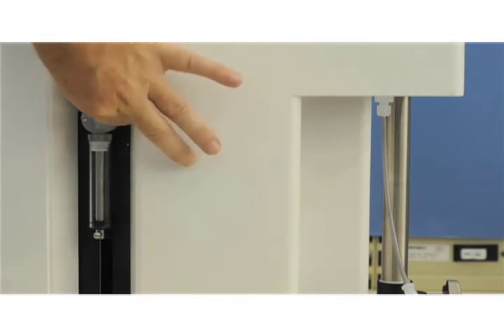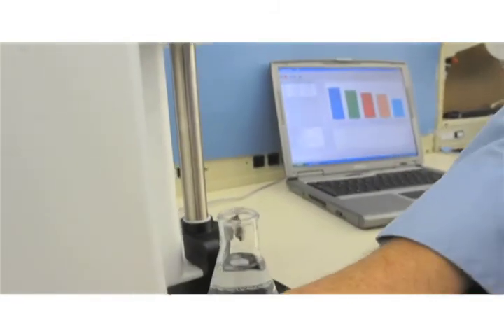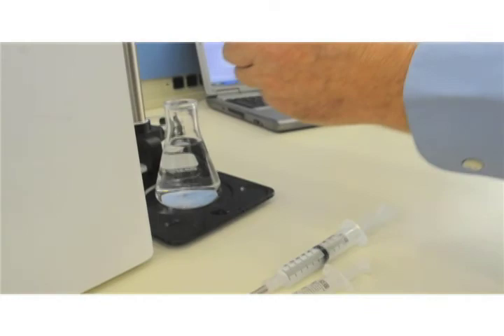Be careful not to cross-thread the fitting. Finger tighten. Remove the cleaning syringe from the sample inlet and reconnect the sample tube.